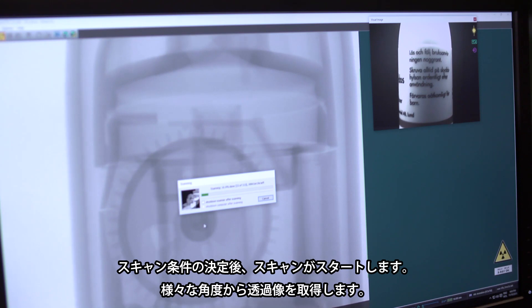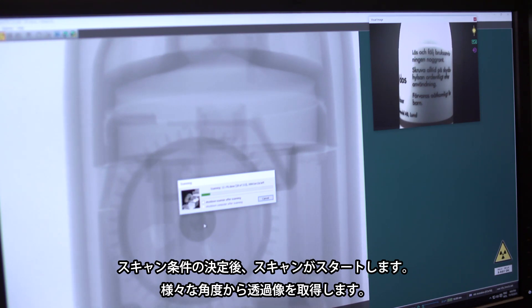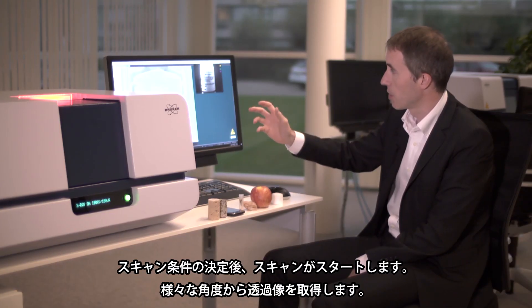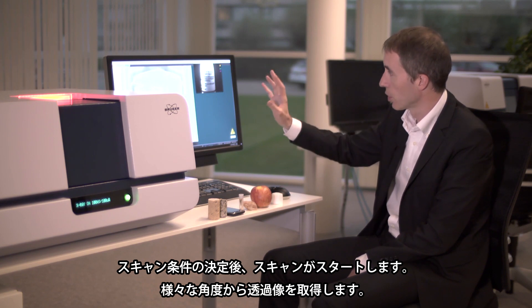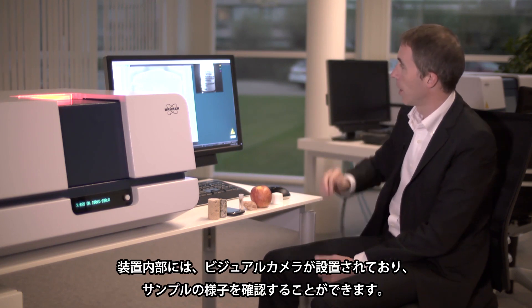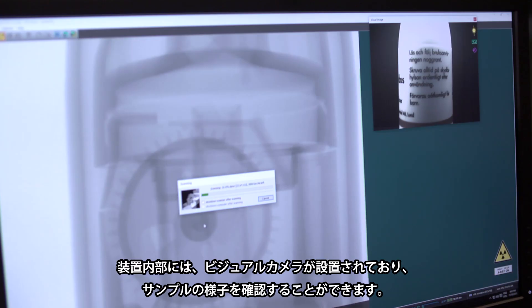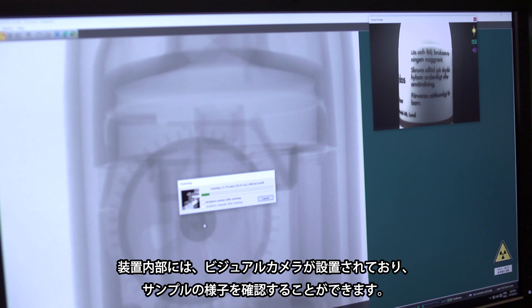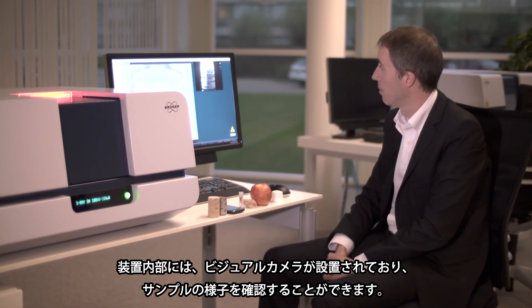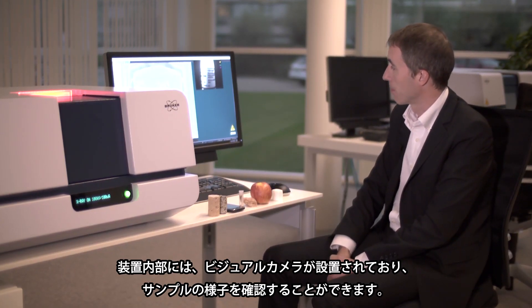Once it's done that, it will start the scan by acquiring projection images over multiple angles. As you can see there's also a small live video inside so that you can have a look at what's going on while the scan is busy.